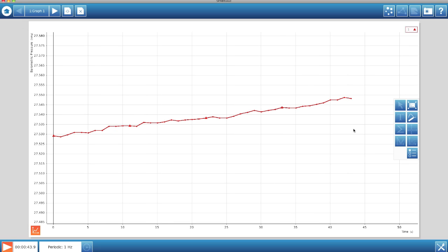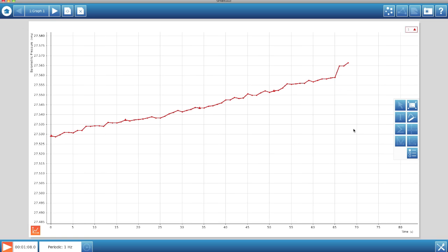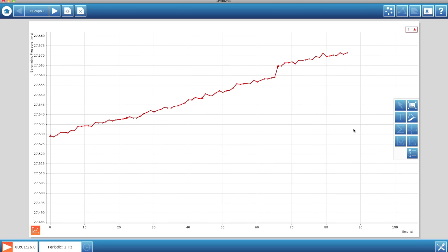But you can clearly see that our pressure is slowly increasing. And that means that water from our hypotonic solution is moving into the hypertonic baggie, and that's causing water to be forced up the tube, compressing the air, and the pressure sensor is recording that. So what we have here is a beautiful direct measurement of the osmotic pressure moving from one side of a semi-permeable membrane to another. So I really hope you've enjoyed this digital lesson and that you have fun trying some different methods with your dialysis baggie experiments.